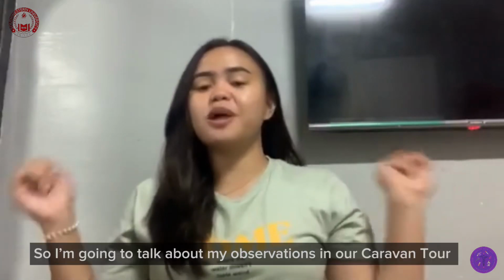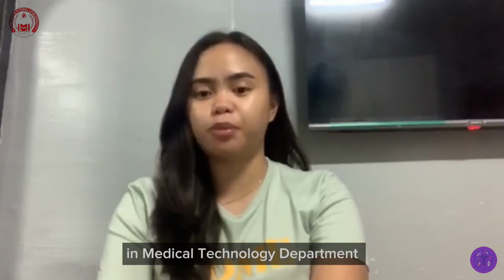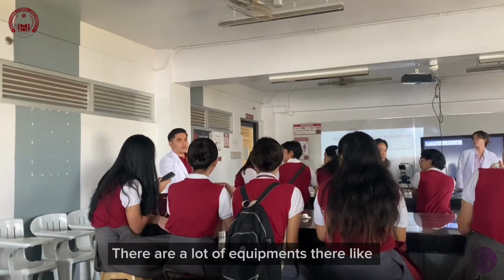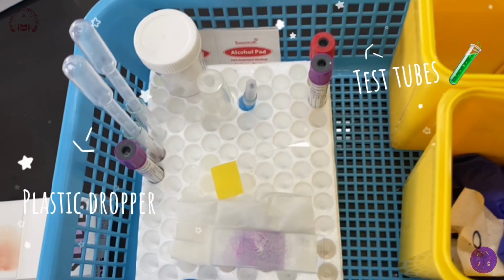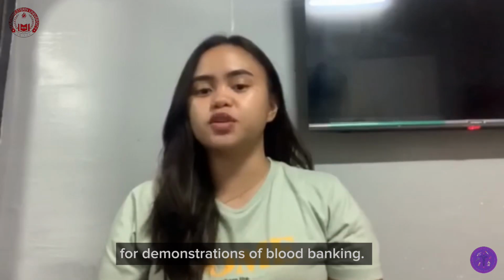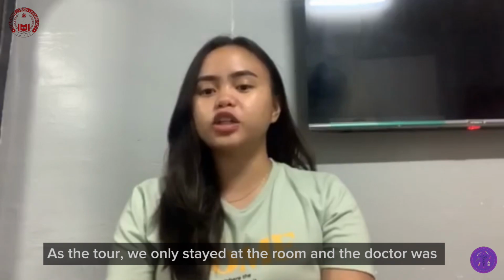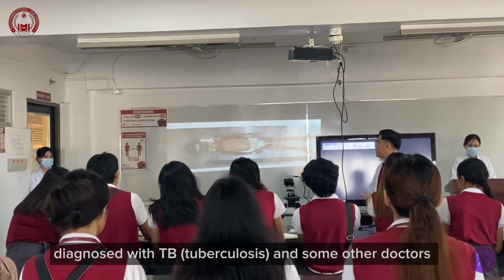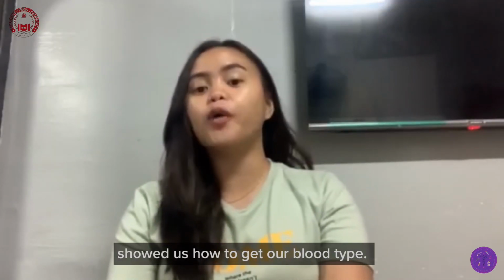Hello everyone, I'm going to talk about my observation in our Caravan tour in the MedTech department. In the room where we had our discussion, there was a lot of equipment like microscopes, test tubes, plastic droppers, blood smears, chemicals, test kits, and clay for demonstration of blood banking. On our tour, we only stayed in the room and the doctor talked about a case from years ago, where a patient was diagnosed with TB, and some other doctors showed us how to get our blood type.